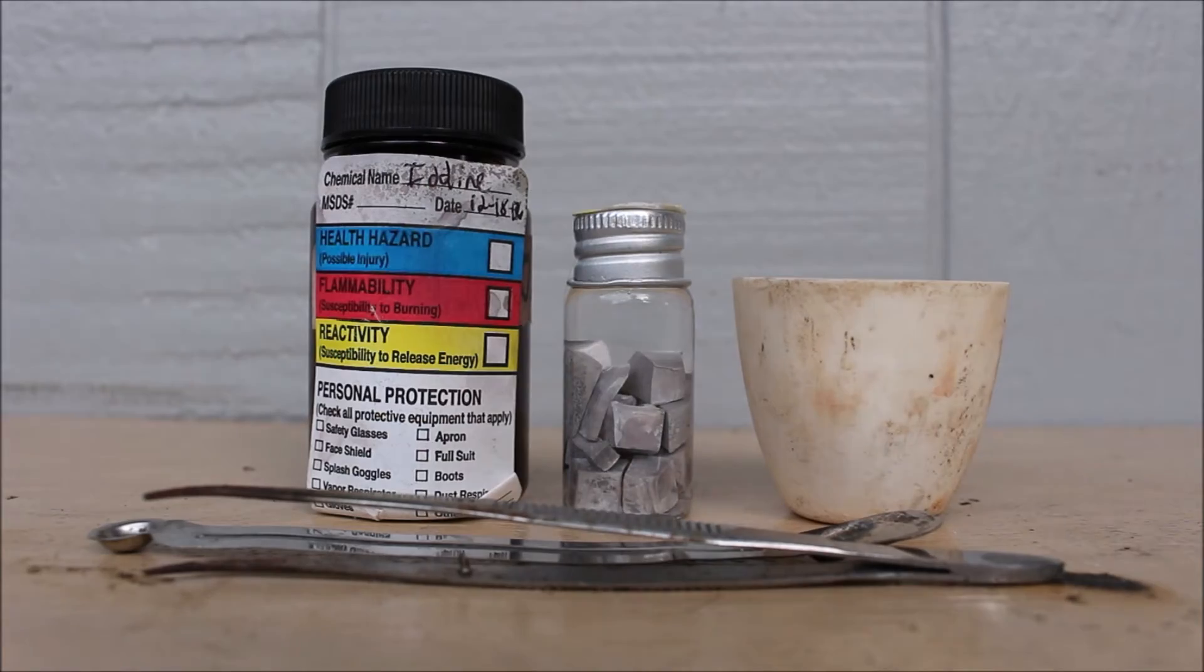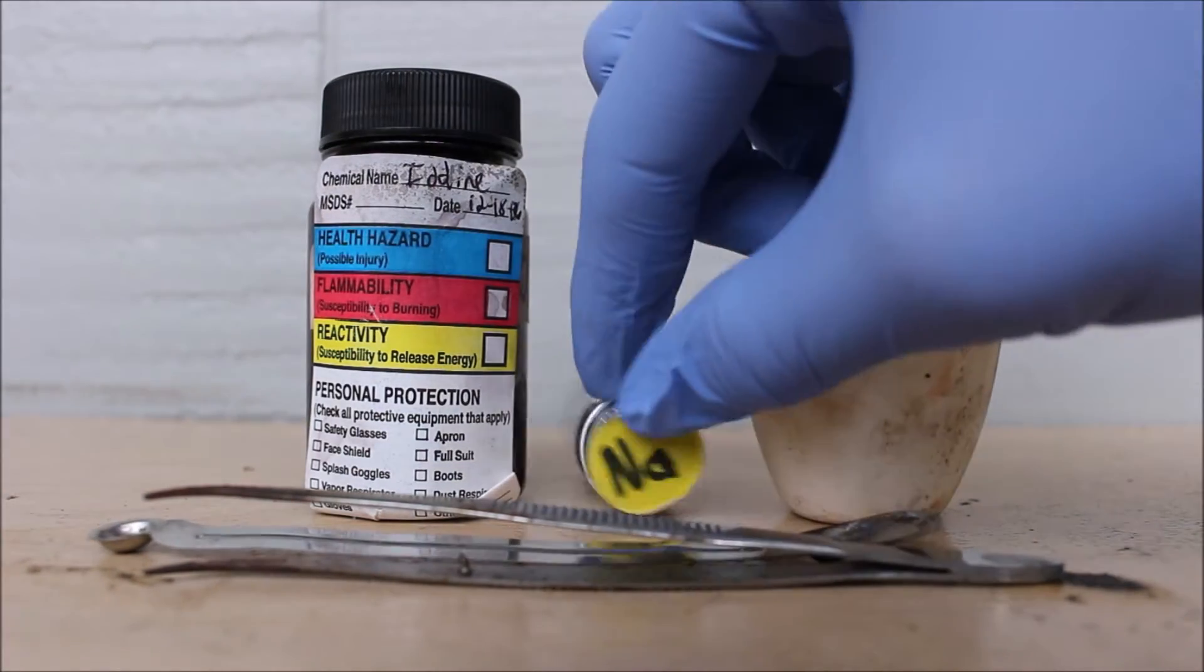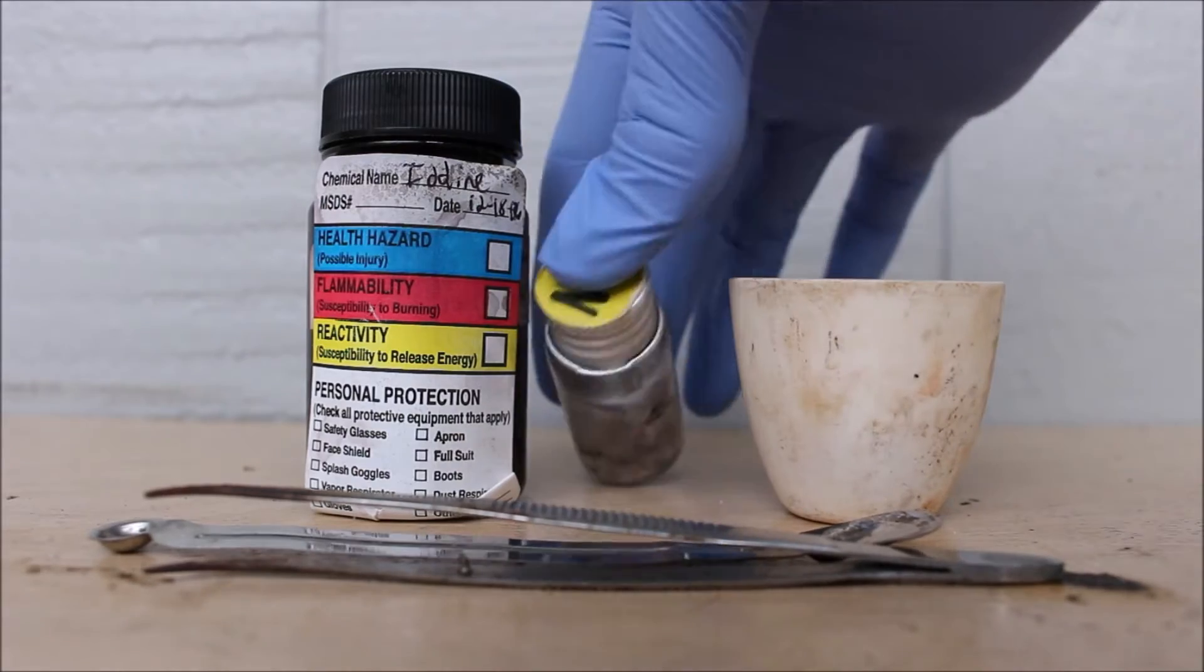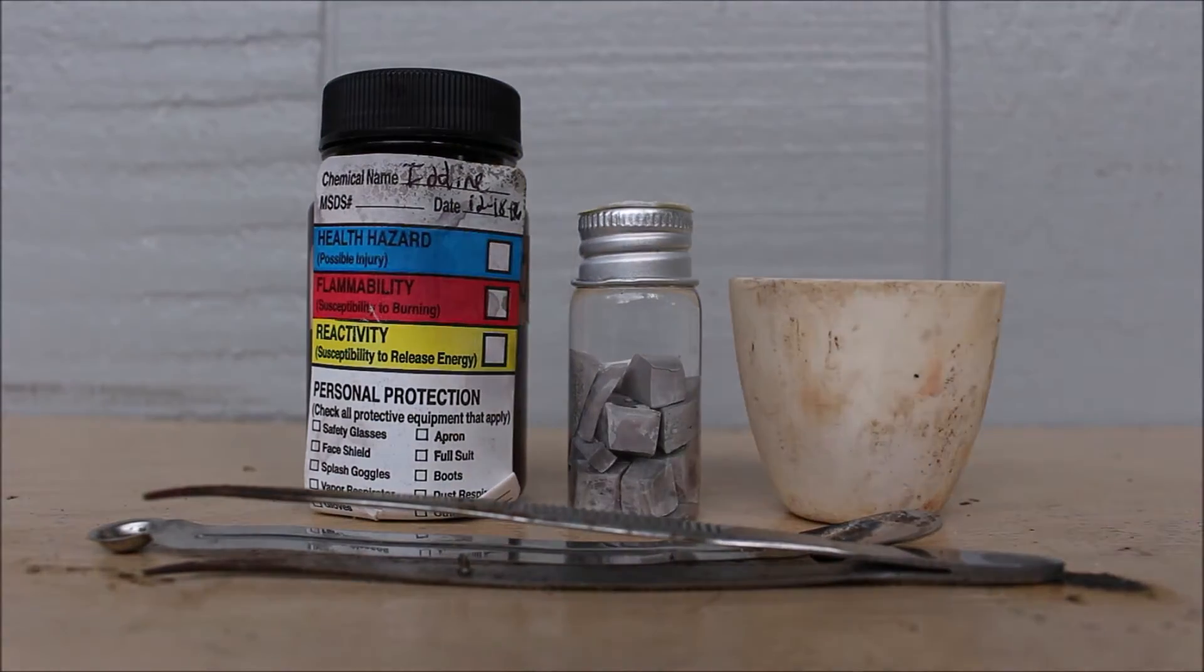So anyway, we just wanted to show you this reaction because it's a pretty cool one. And it also makes some pretty nice colors, like purple when the iodine vaporizes.